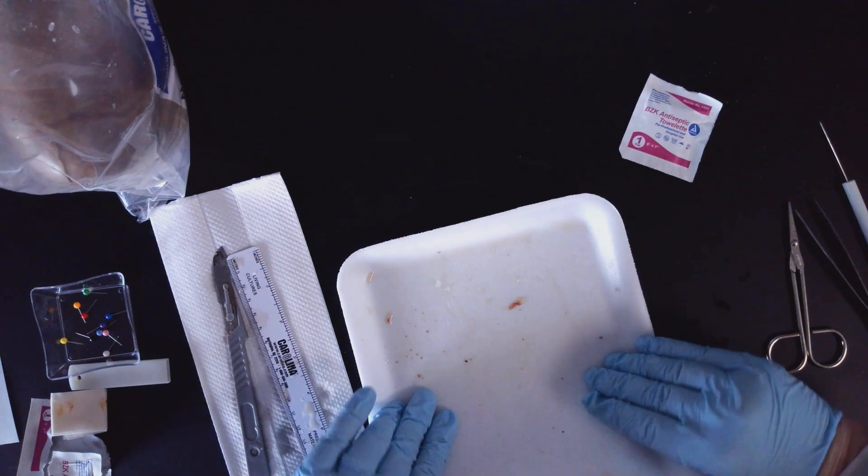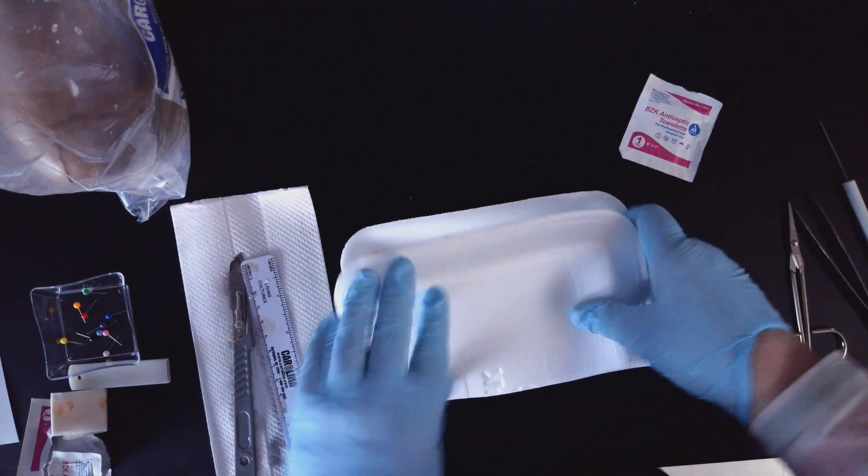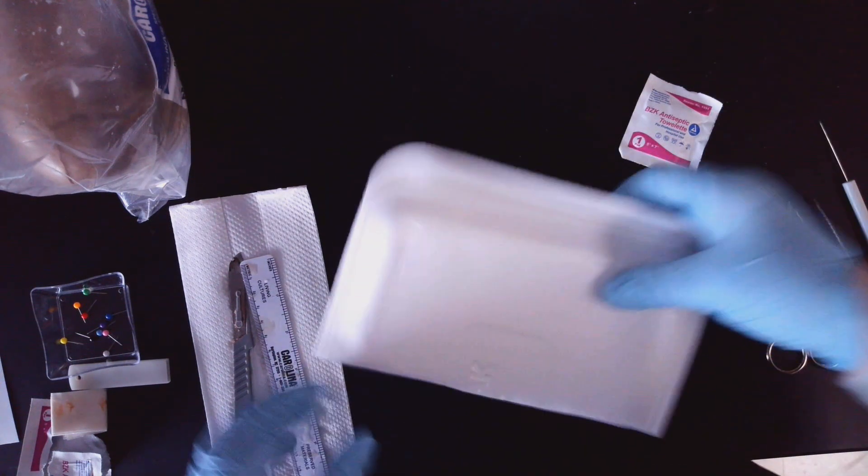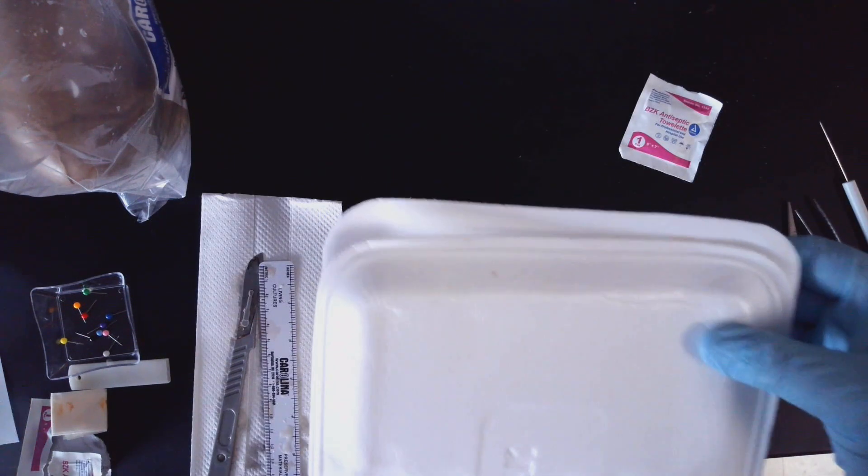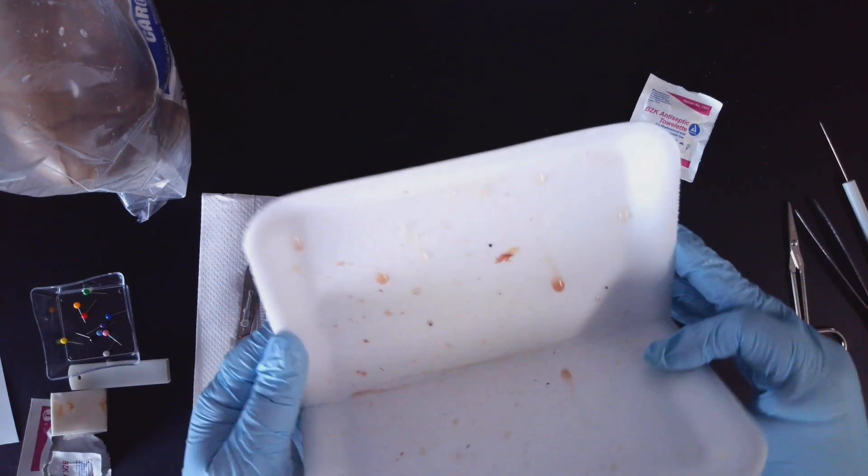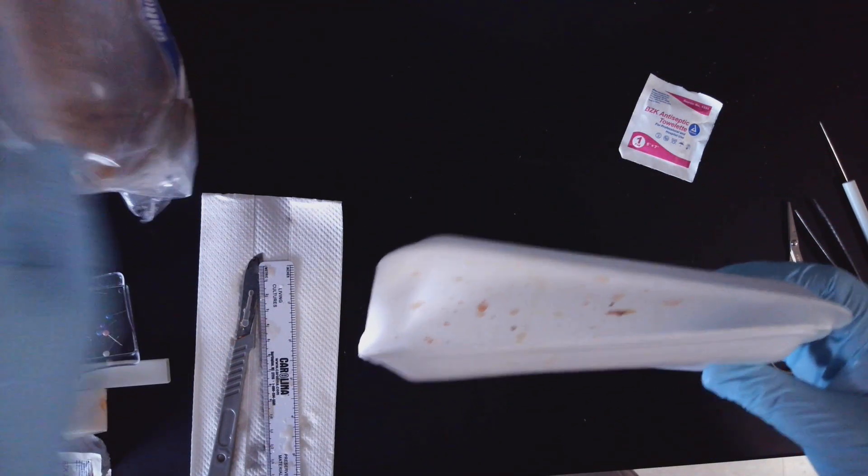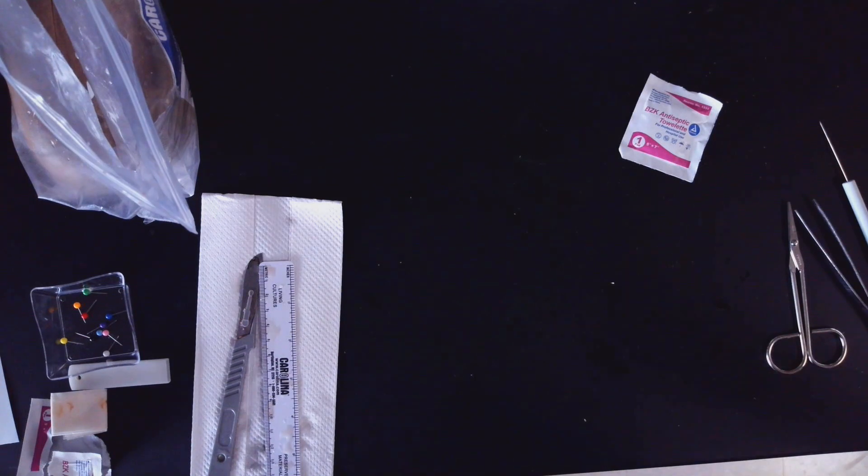Take the tray out - say I dumped all the juice. Then I'm going to bend this in half. I'm going to go toss this in the garbage. Remember I took all of those pieces off, mostly dumped the juice into the ziploc bag, and I'm going to toss this.